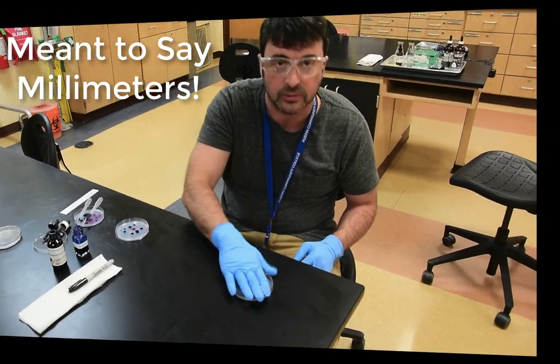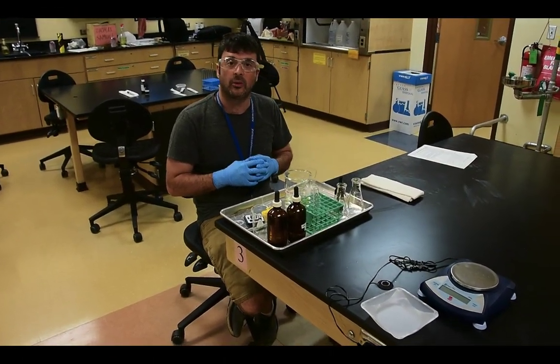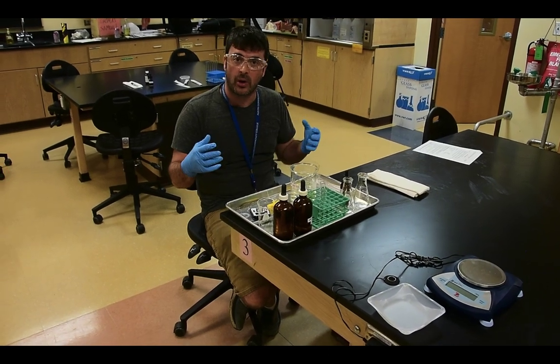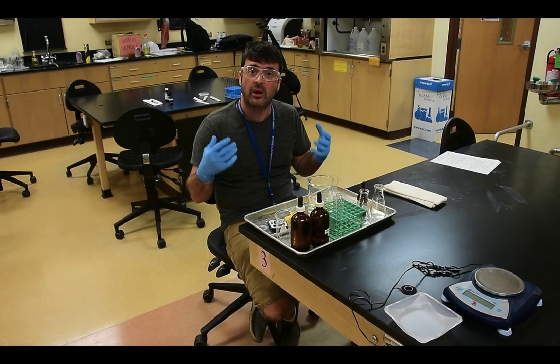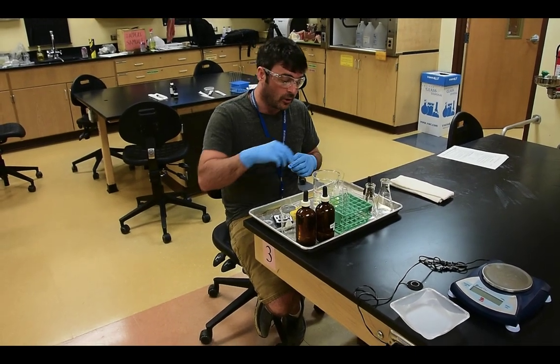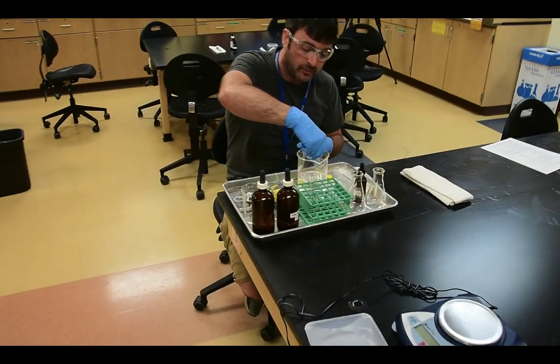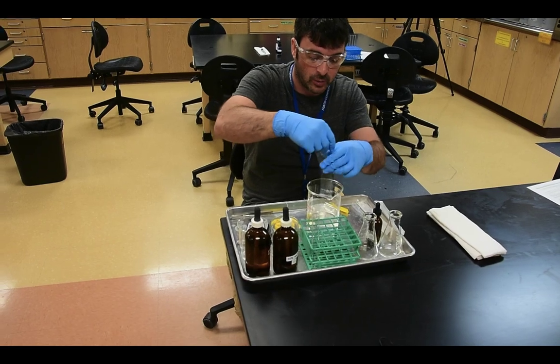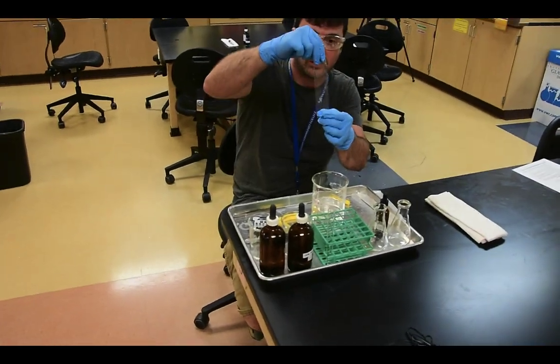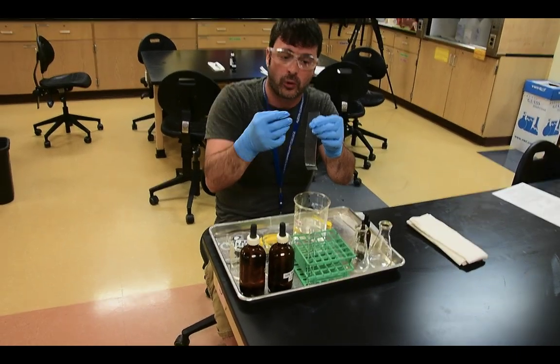Now in the second part of today's lab, we're going to be looking at the permeability characteristics of membranes by using an artificial membrane to evaluate how we can figure this stuff out. The artificial membrane we're going to be using today to create our cell is called dialysis tubing. And dialysis tubing, which we're pulling out right here so you can see, is interesting because it's porous, whether you can see those pores or not.